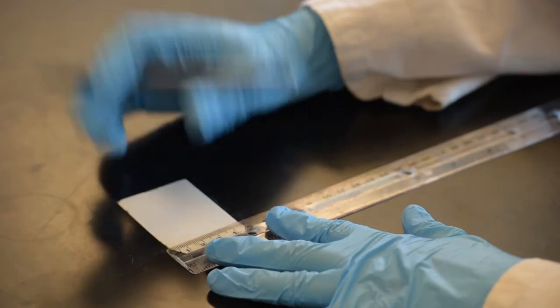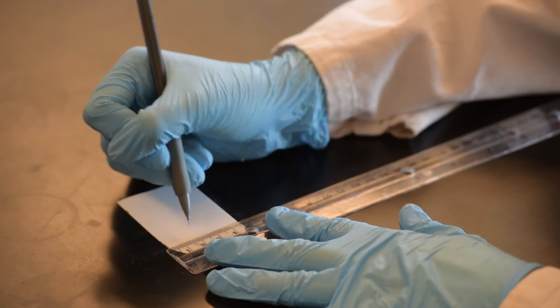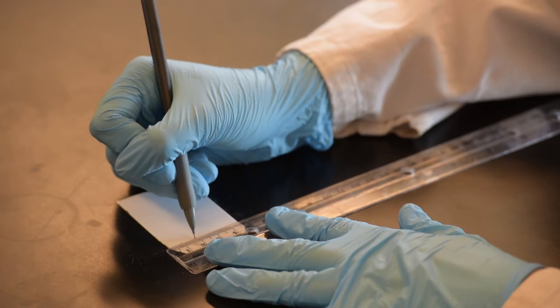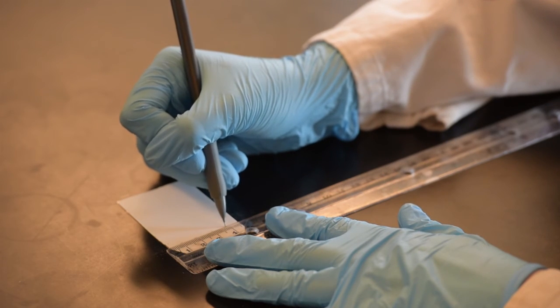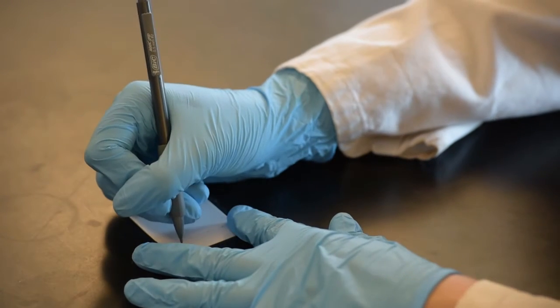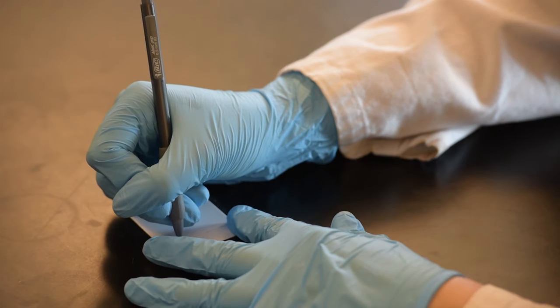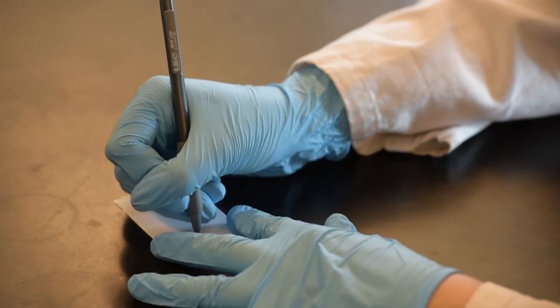Count how many samples you are considering. Measure the width of the plate and determine an appropriate spacing. Remember, you must leave spacing between the edge of the plate and the sample spot, so take that into account as well. Generally, the spacing will be about 0.4 centimeters apart. Gently make a point after an appropriate spacing interval, and under each spot, label what you will be putting there.